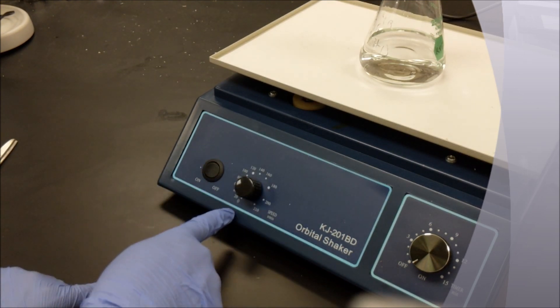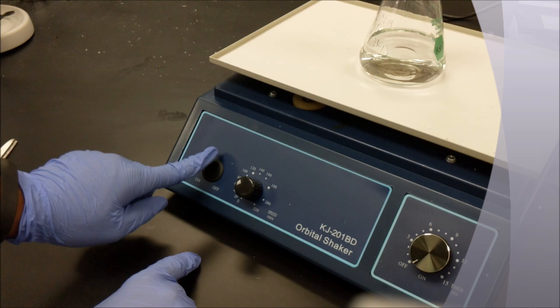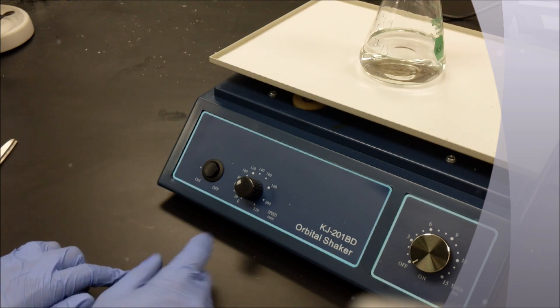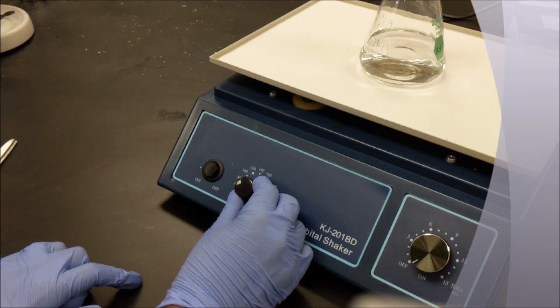Notice there is a knob for time, another knob for revolutions per minute, and an on and off switch. Begin by turning the platform on.